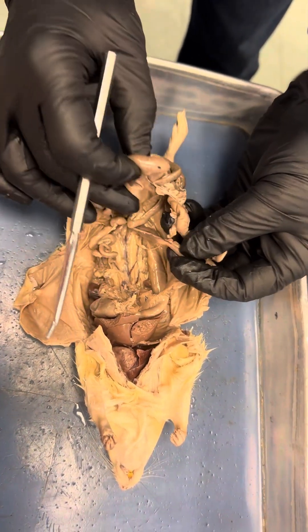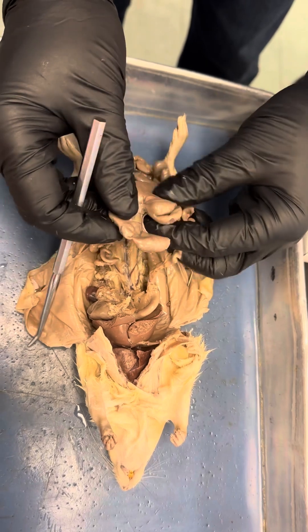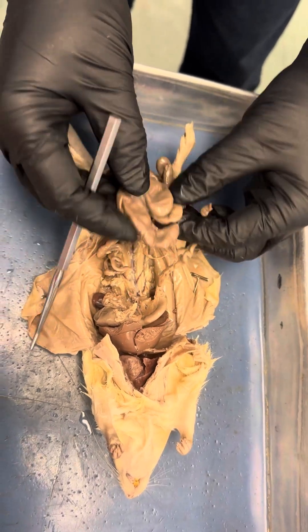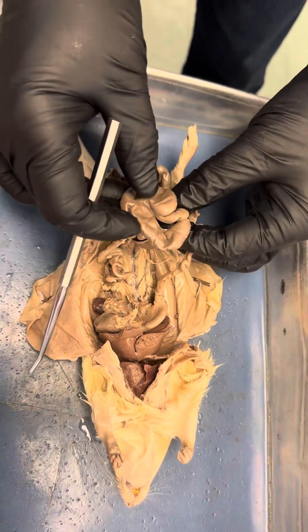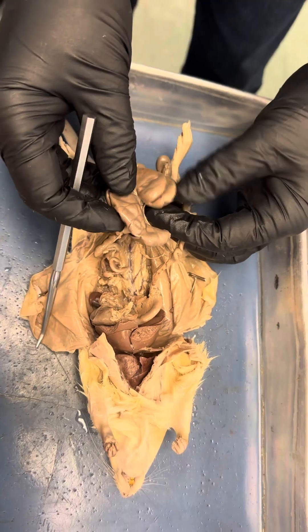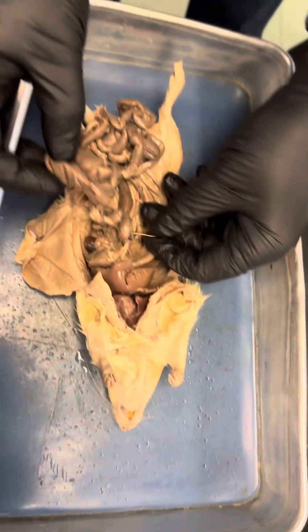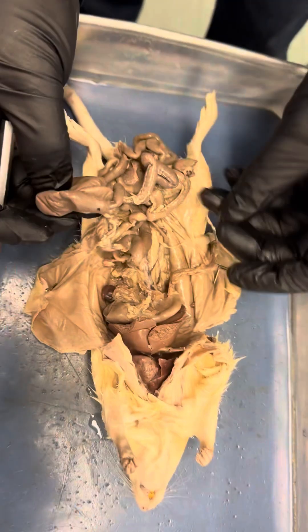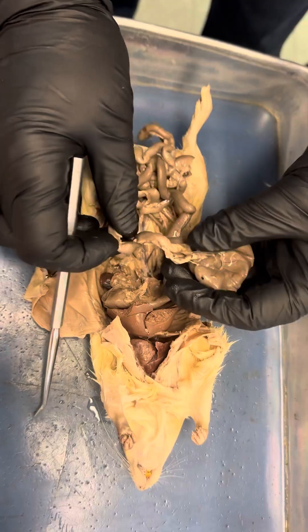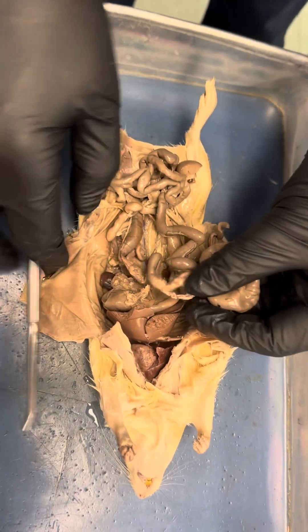And the ileum — remember, the ileum actually connects with the cecum. See, this is the cecum. It looks like a stomach, right? The rat has a huge cecum.